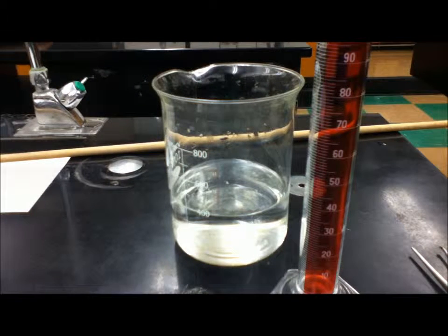Alright, this is the second video. We're looking at the lab using iron to find percent oxygen in air.